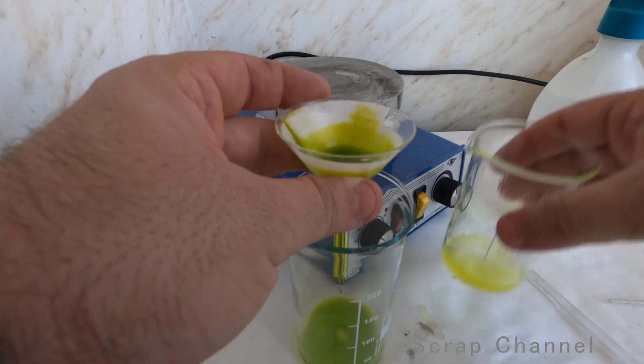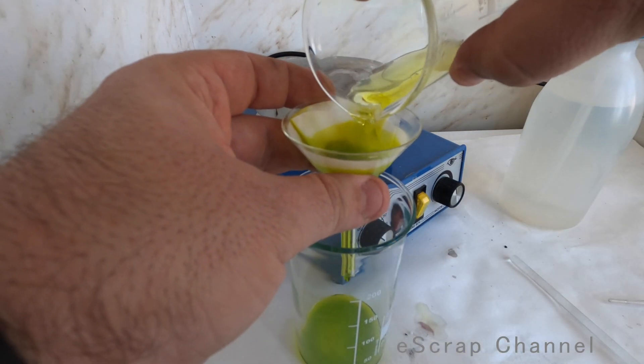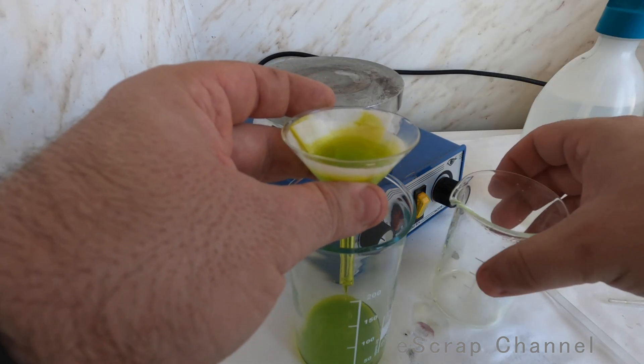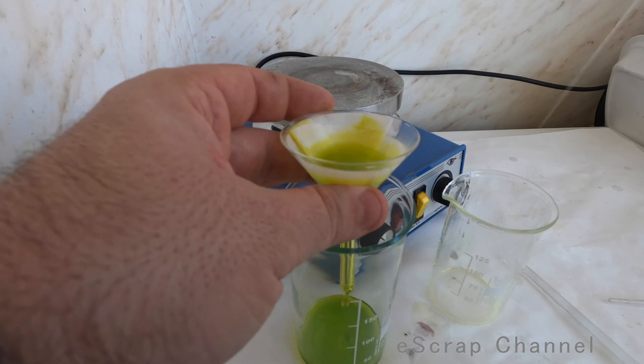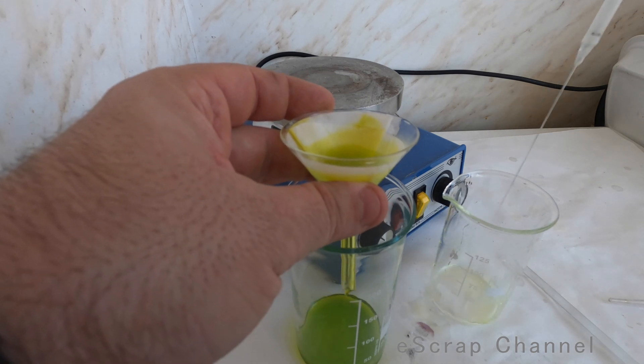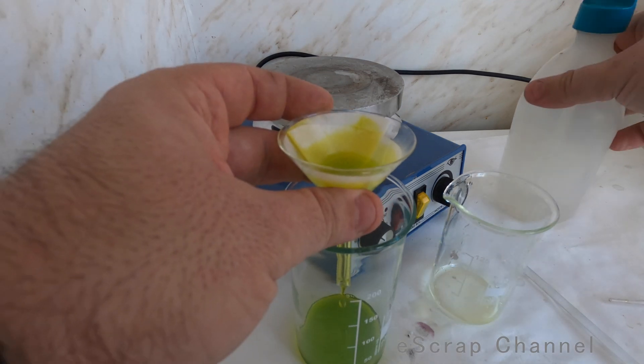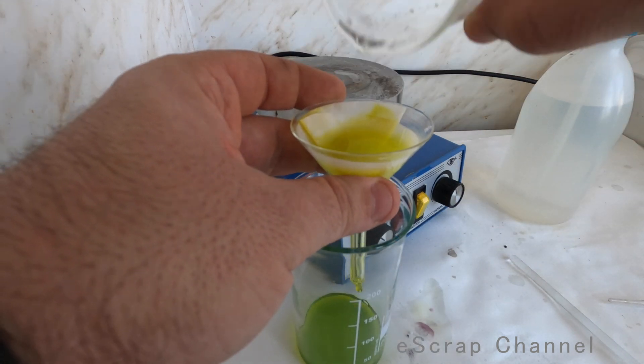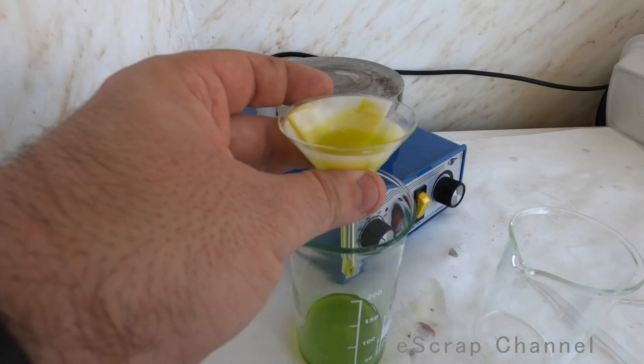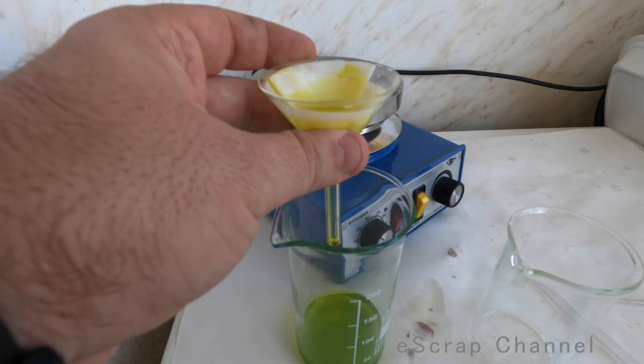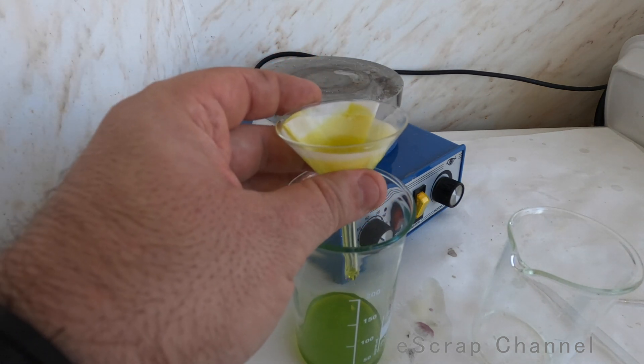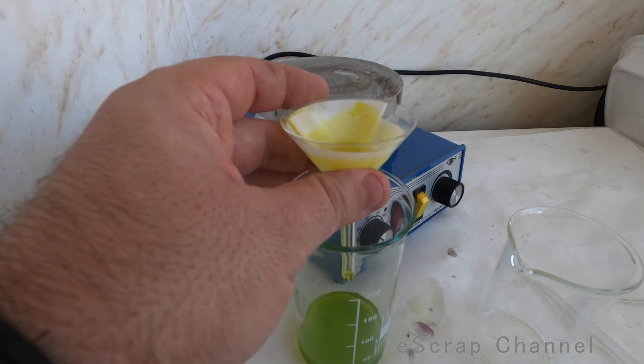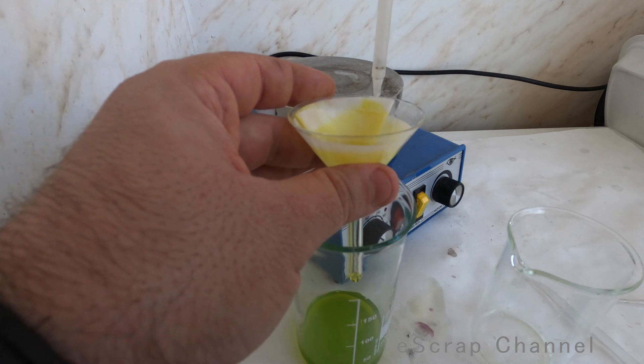Okay, so let's filter well and rinse well to be sure we are not losing any gold. Here we go. So now I will just wait a couple of minutes and rinse it well and after that we recover the gold for my friend. So surprise, there is gold.